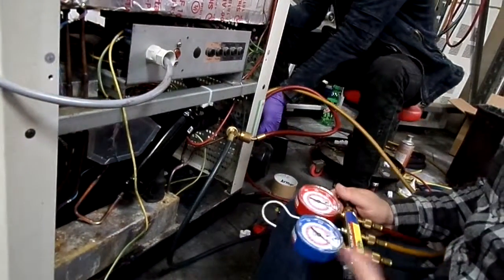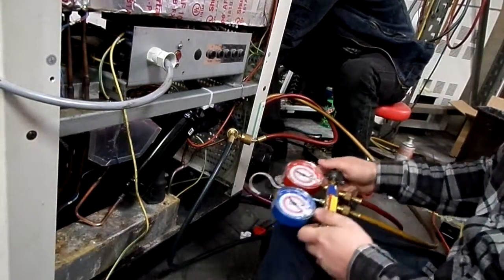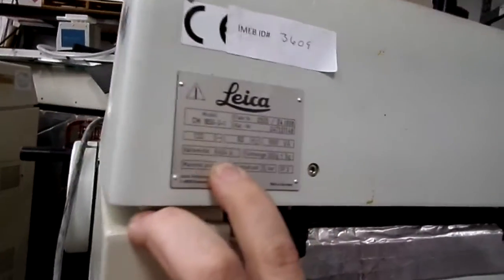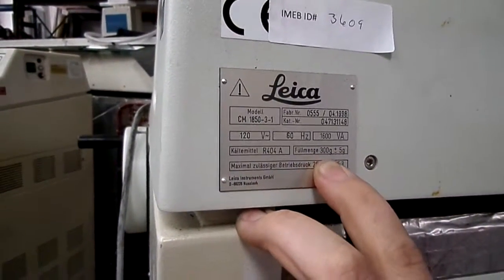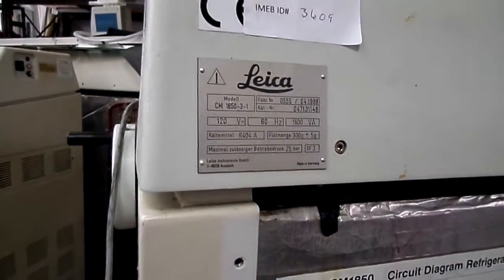Jesse will be a deer and turn off the vacuum pump and disconnect the yellow hose. Now all these machines, you'll see up here, have the type of refrigerant. It's German, but R404A is the refrigerant, and then how much goes in it. So it's 300 grams plus or minus 5. So I'm gonna put 300 grams in it.